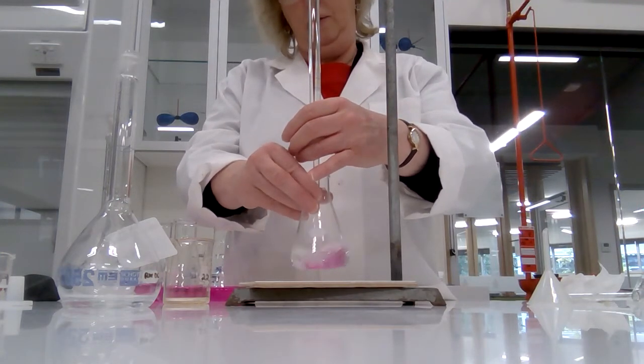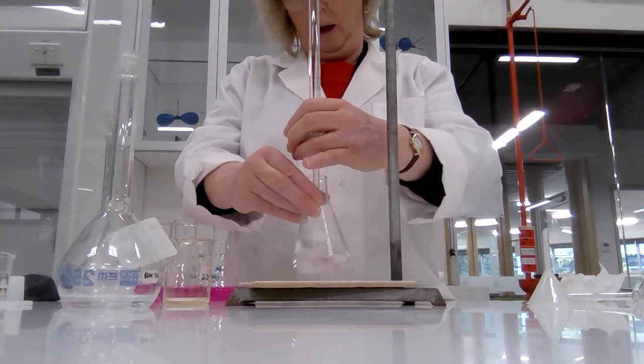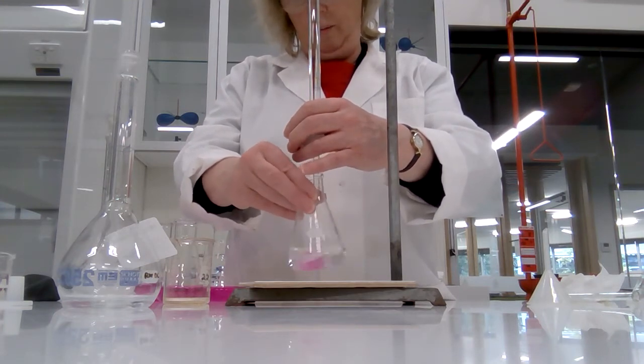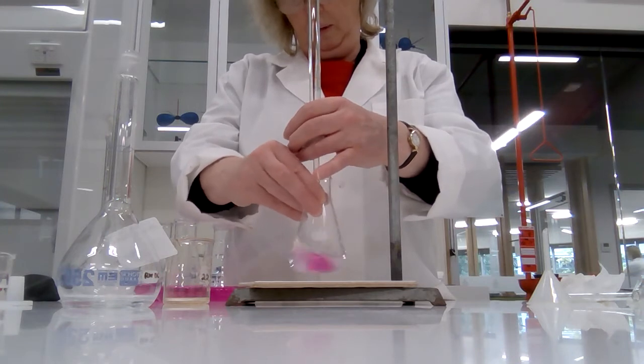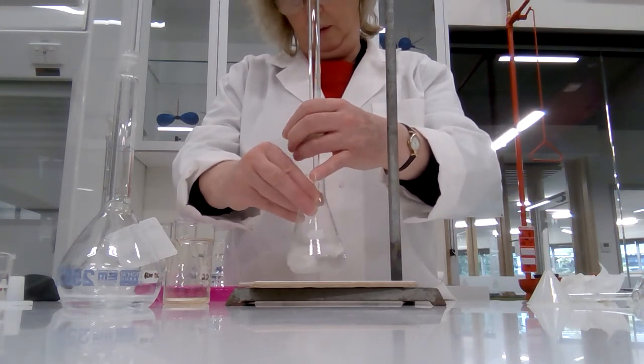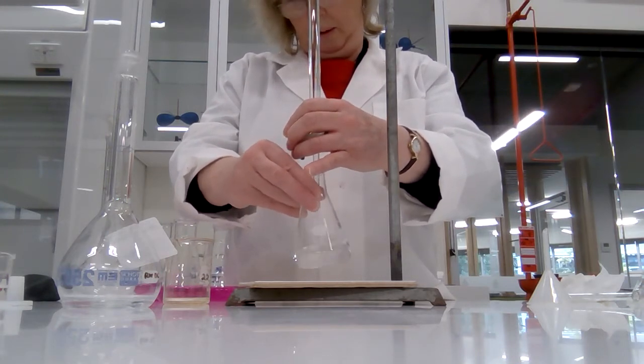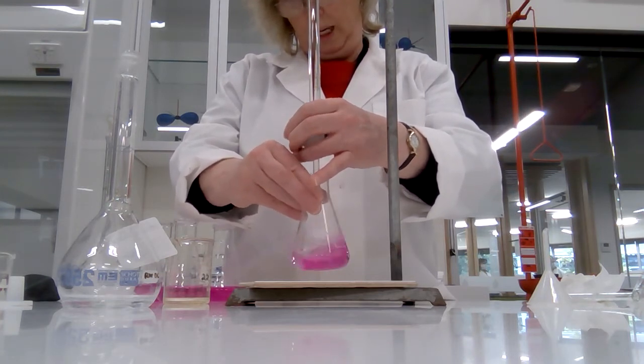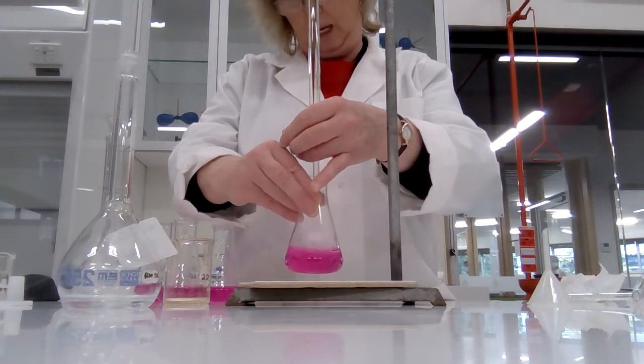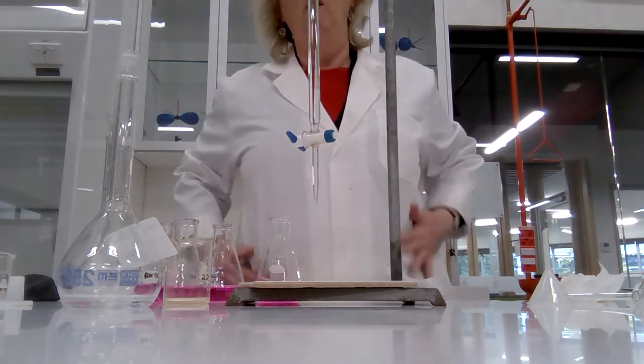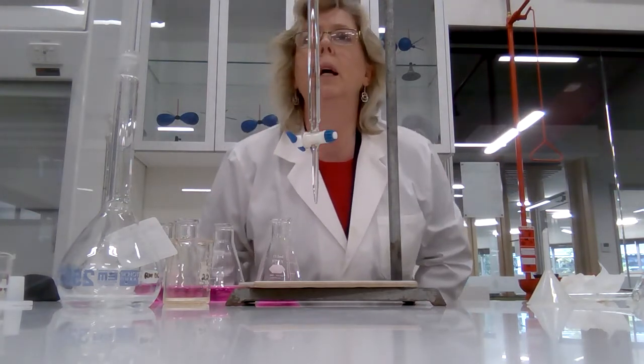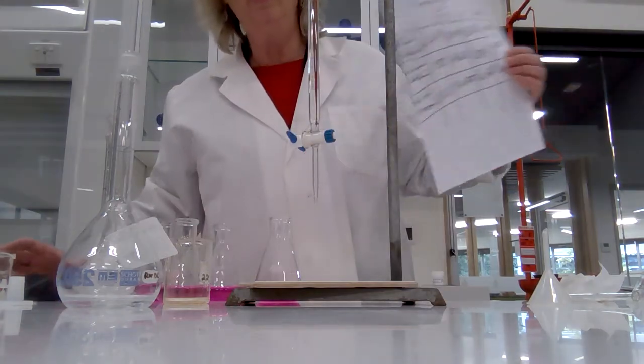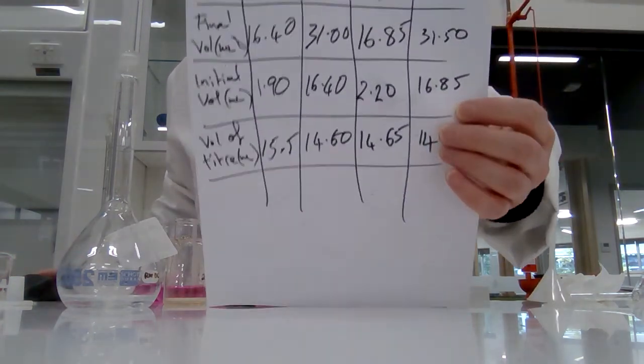Getting close. Once again, I'm actually not looking at the volume. I'm looking at the color change. Give it a swirl. No. Keep adding. It disappears when I'm swirling. Oh, and there it goes. Oh dear. I wonder if I went over. Oh, lucky, lucky me. 31.50. Allowing myself a moment of triumph.